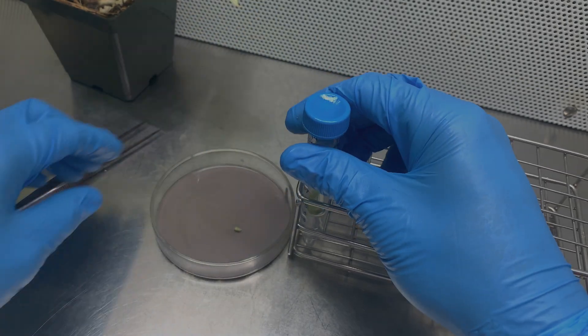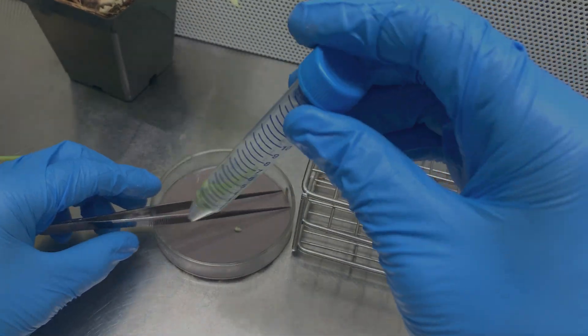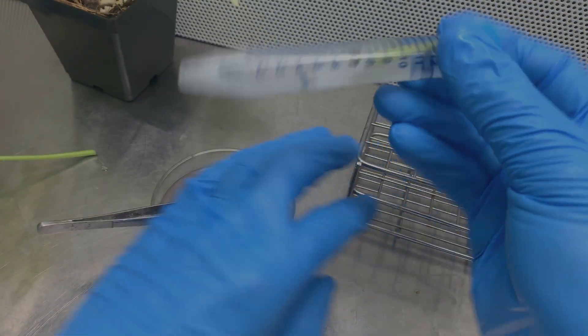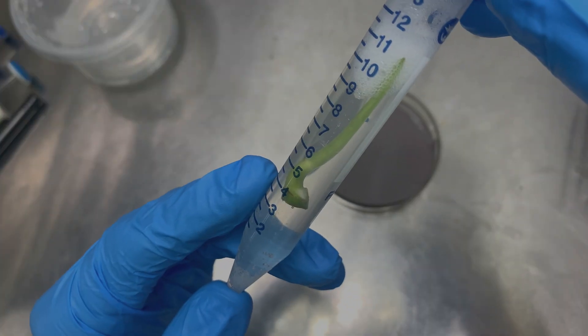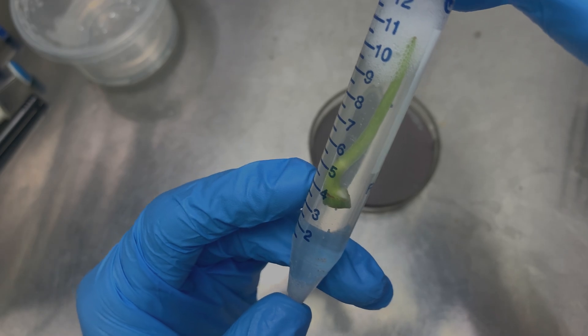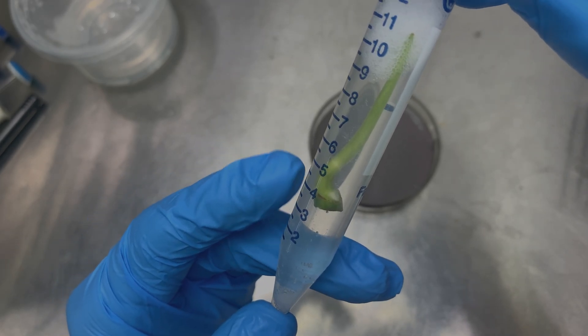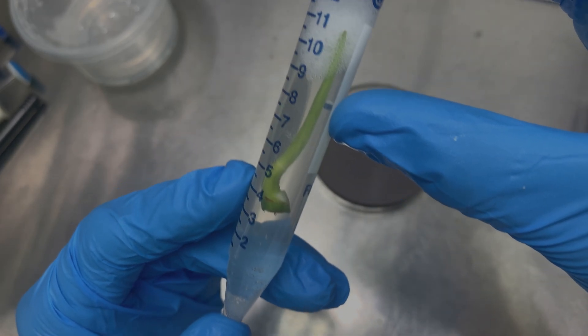And now what I want to do is give it between 10 and 15 minutes, so I'm going to set my timer and I'll be right back when this is ready.